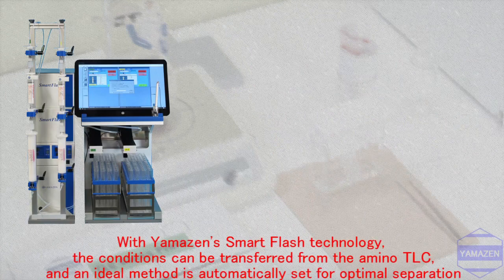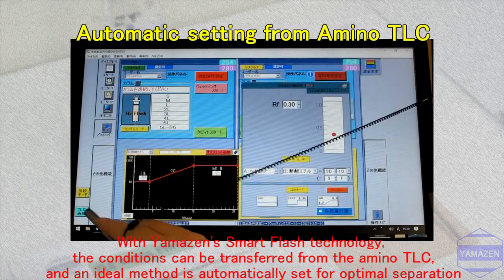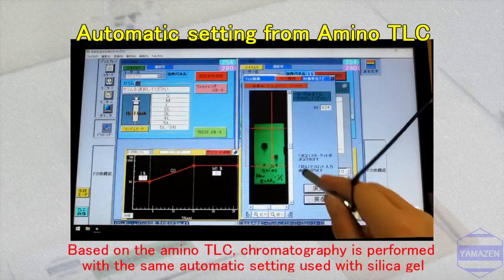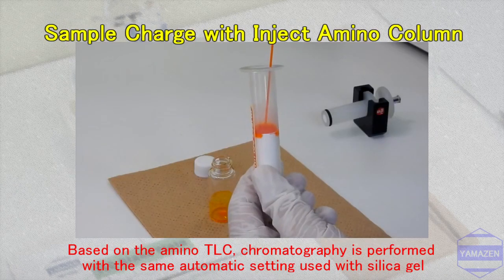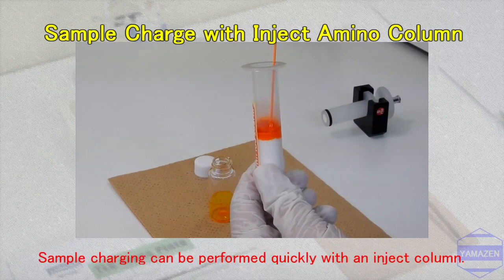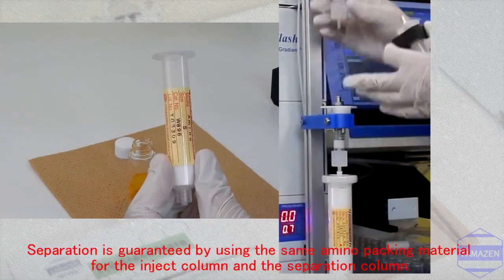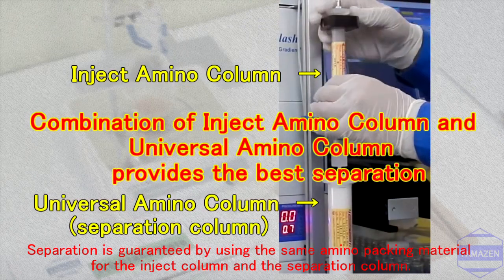With YAMAZEN's Smart Flash technology, the conditions from the amino TLC are transferred to the column using the same automatic setting used with silica gel, and an ideal method is set for optimal separation. Sample charging can be performed quickly with an inject column. Separation is guaranteed by using the same amino packing material for the inject column as the separation column.